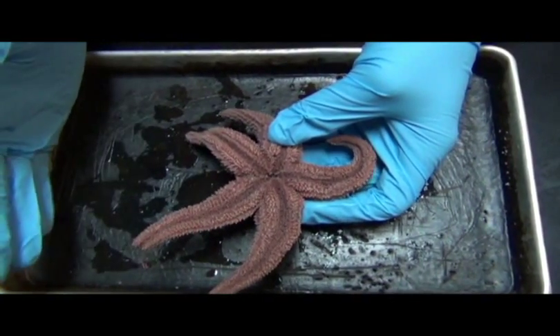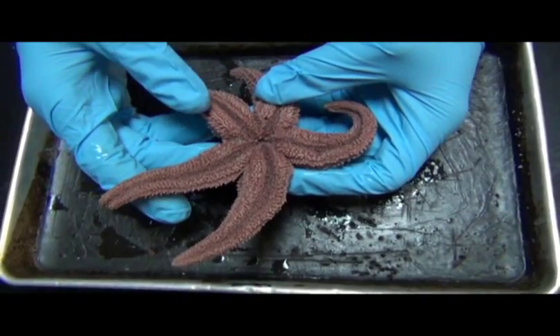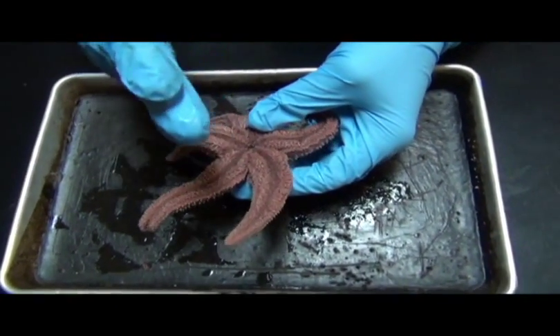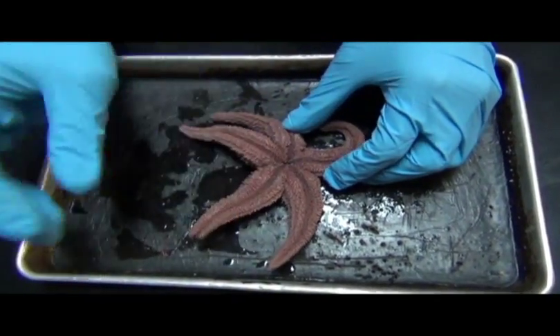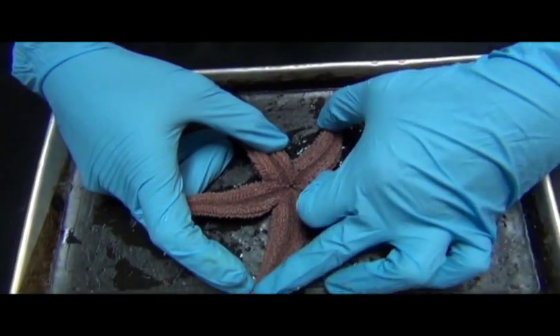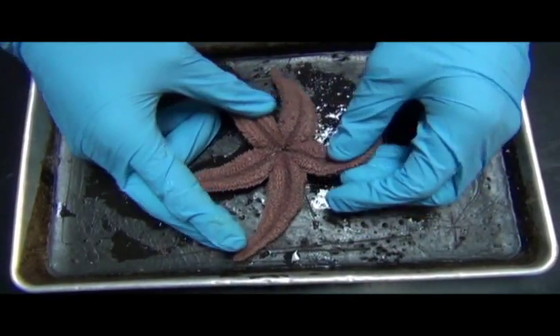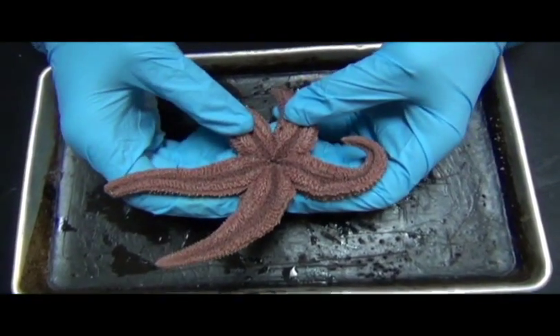You can't say left and right because radially symmetrical animals don't have a left and right, but radially symmetrical animals can be cut pretty much in half if you were to take a line down the midline that goes through the center. For instance, if you were to stretch this guy out, and take a line and just cut directly from here down through here, you could see that there would be pretty much equal halves. And so that's sort of a signature of a radially symmetrical organism.